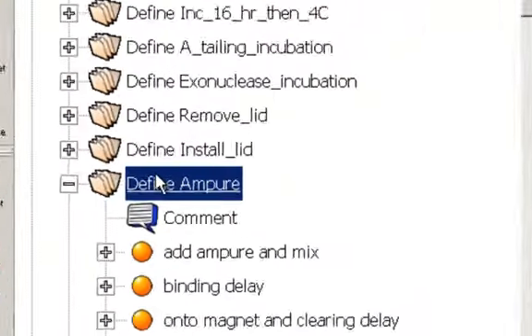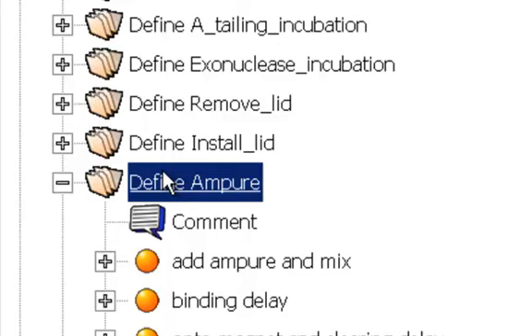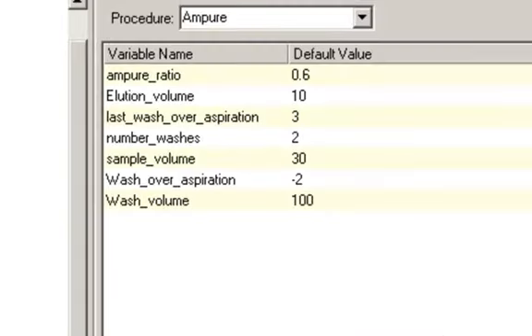Okay, now let's look at one more procedure, the AMPure procedure. This procedure is called every time we want to do an AMPure on the plate, and let's look at the variables that we pass it when we call it. The first one is the AMPure ratio. By default, like I said, it's 0.6 for the 2K library prep. We have our elution volume. We can change that. There's a couple variables here.